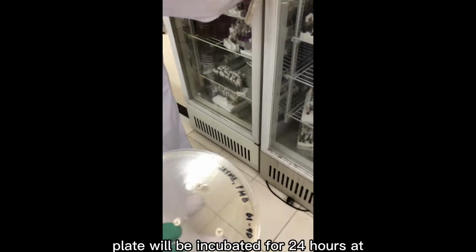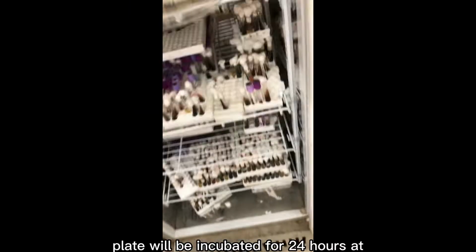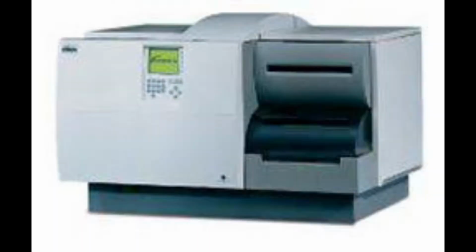The plate will be incubated for 24 hours at 37 degrees Celsius.